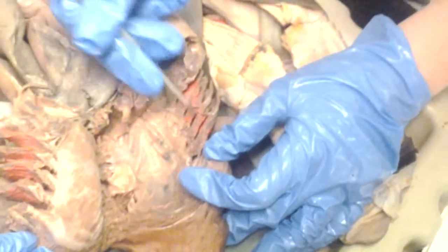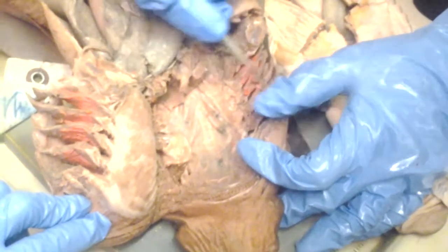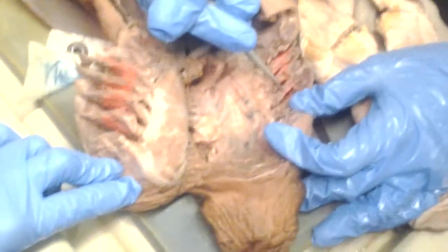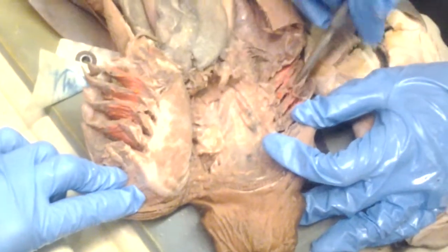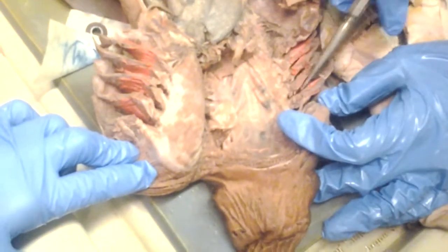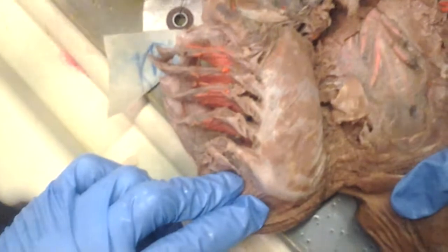Are the internal gills a supportive structure? Is it cartilage? Well, the gill has cartilage in the middle, so it has the gill arch cartilages. I don't understand the question. Can you reword it? Oh, gill slits. The internal gill slits are right here, so it's basically the opening to the gills on the inside. It's not a structure, it's just a space, an opening. So this is the internal gill slit with the gill rakers covering.